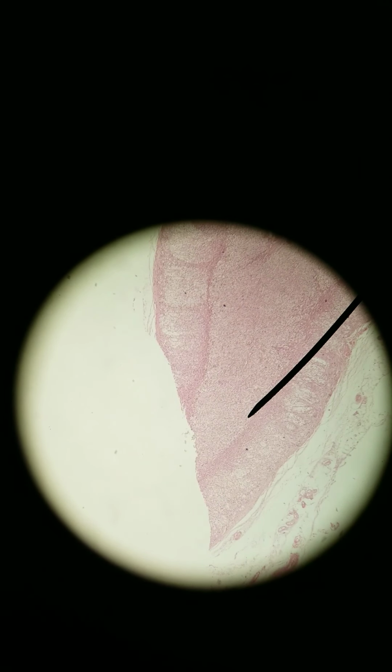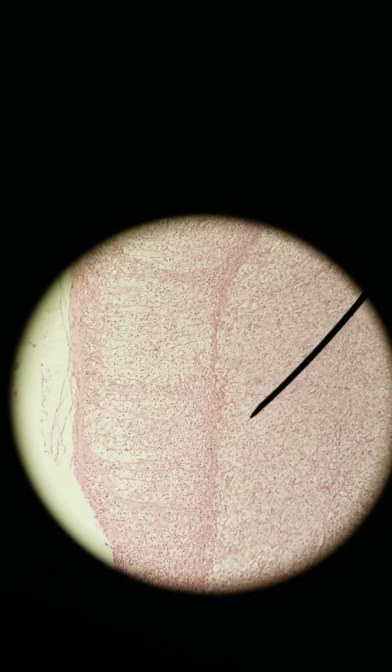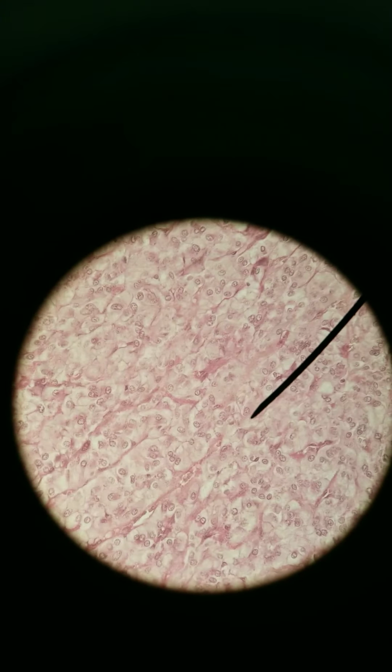All right, so let's look at the adrenal medulla first, the very center here. I'm going to go to, where are we at? 100x. I'll keep us by the border between the cortex and the medulla so we know where we're at. So we're at 100x now. Let's go to 400x. Actually, I'm going to go back to 100. Now I can't tell where I am.